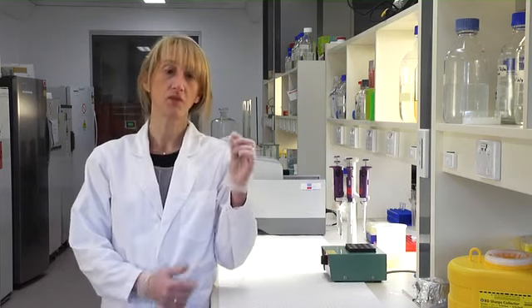So now each tube contains the bits that we want, as well as the bits we don't want, like the bits that have been cut away from the end of the gene. And we need to separate them. And the way we do that is using gel electrophoresis. So let's go and do it.